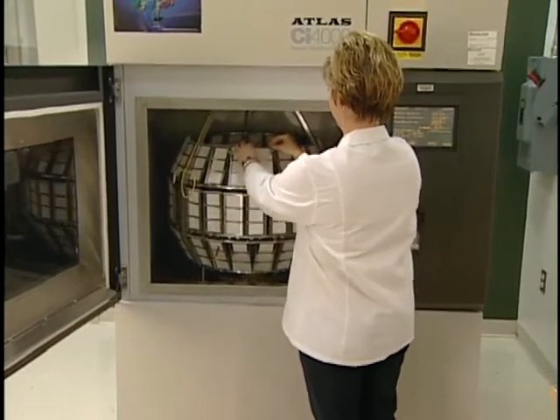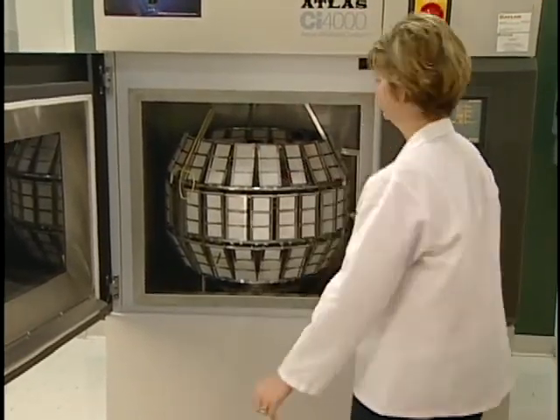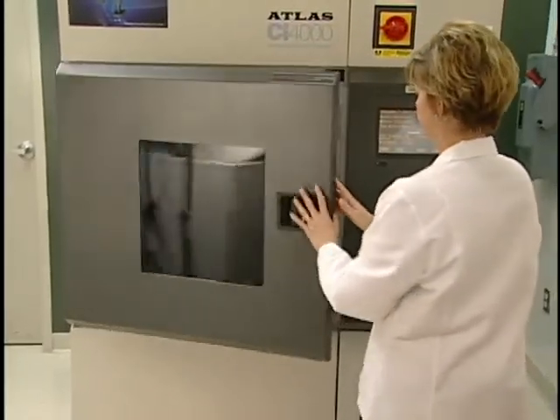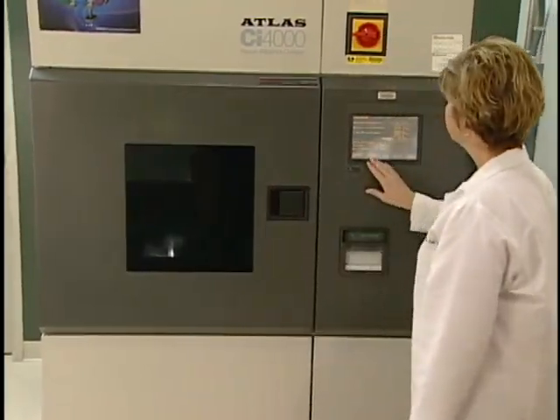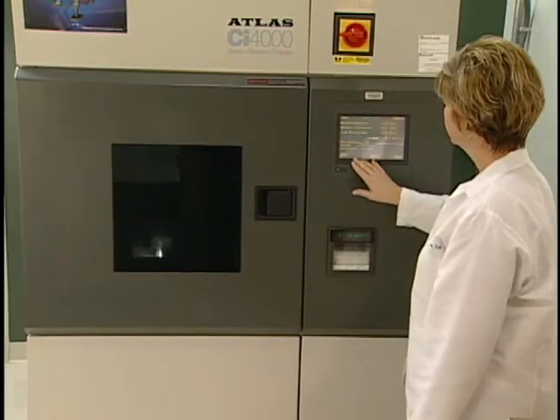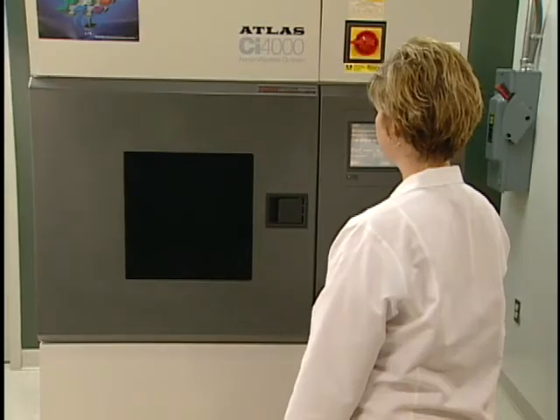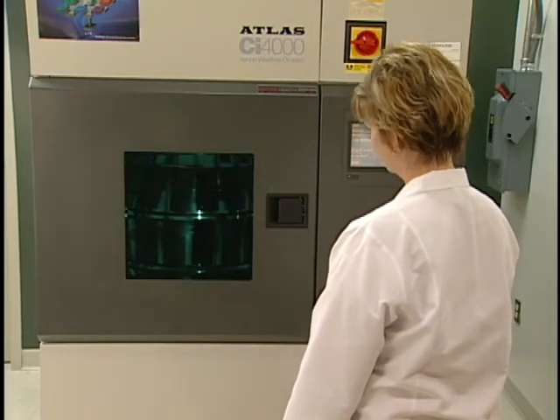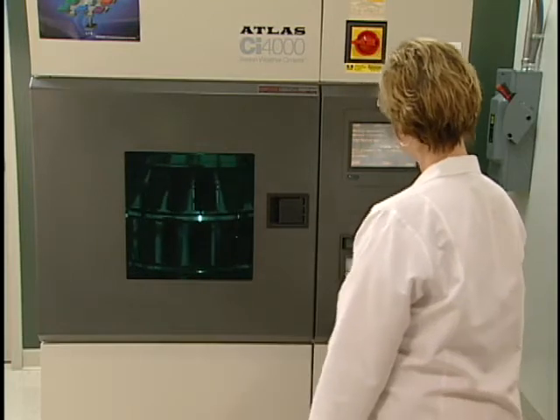To get the required exposure times, a window can be opened for a specified time, such as 20 hours. At the end of this time exposure, the machine is stopped and another window is opened and the cycle is repeated. The result would be that the second opened window would have an exposure of 20 hours, and the first window already exposed for 20 hours would now have a total of 40 hours exposure.